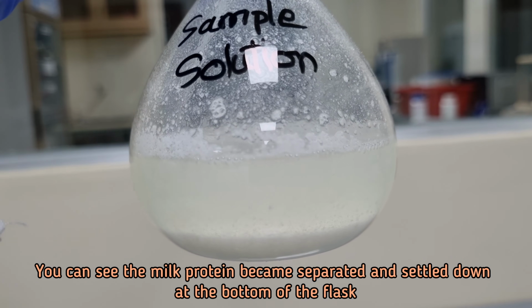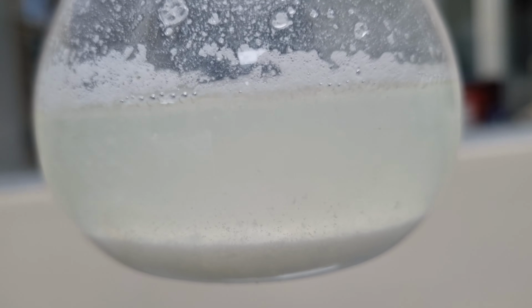You can see the milk protein become separated and settled down at the bottom of the flask.